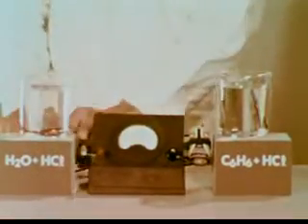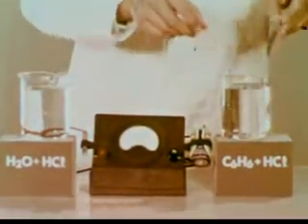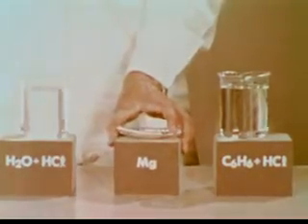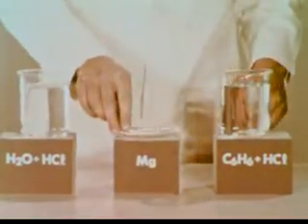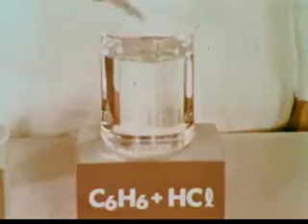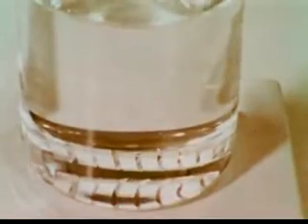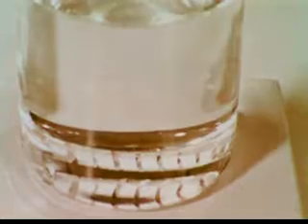Since HCl is present in water as ions and in benzene as neutral molecules, we might expect the chemical behavior of the two solutions to be different. Let's test their reactions to magnesium metal. First, the solution of unionized HCl in nonpolar benzene. It produces no visible reaction.